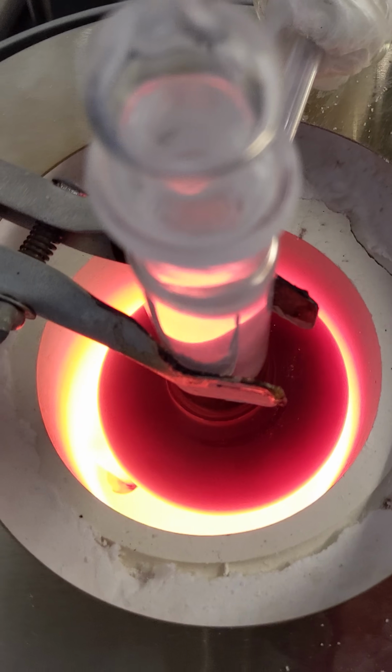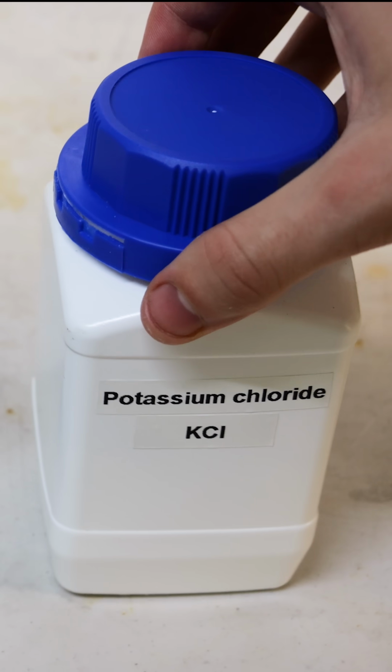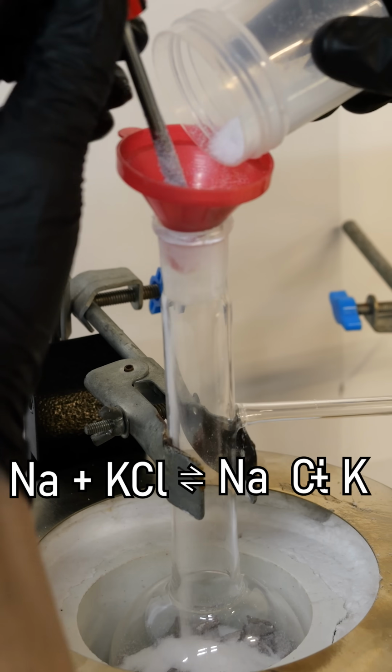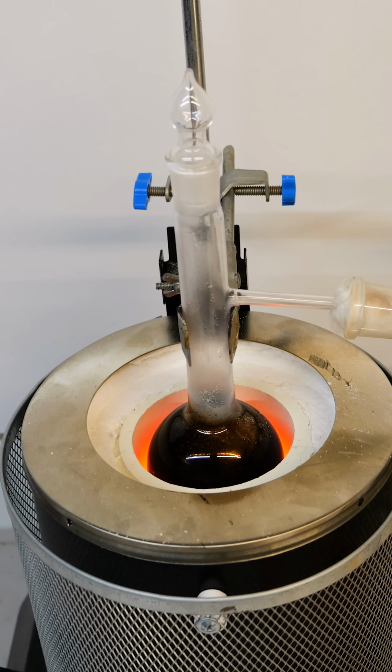I think I accidentally summoned a demon. This black glowing orb on fire is this specialized quartz glass. My idea was to heat sodium metal and potassium chloride in the flask to get a switcheroo reaction that makes potassium metal. As I raised the heat though, it turned into this metallic black orb that glows red.